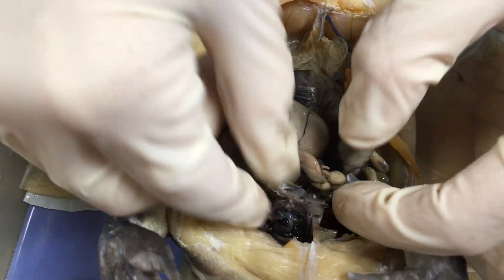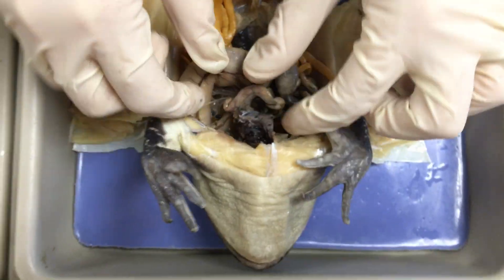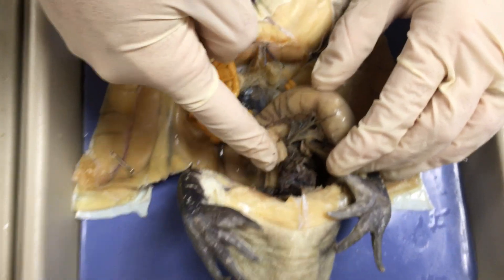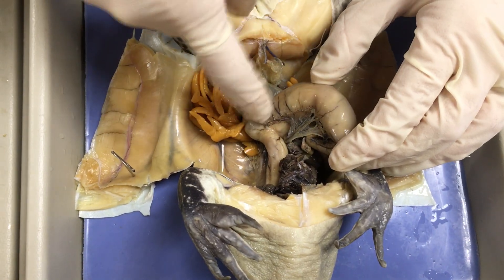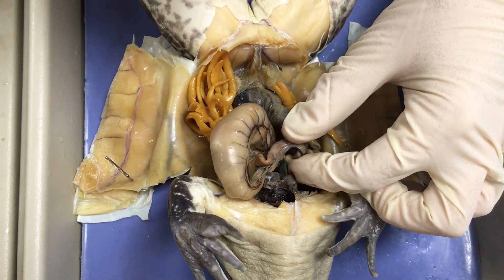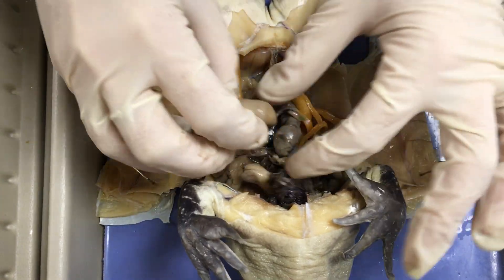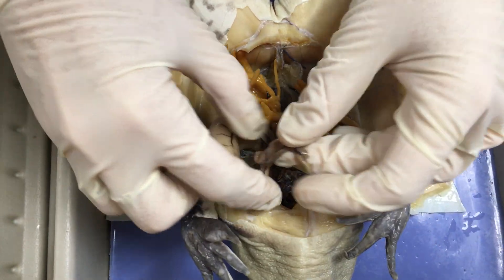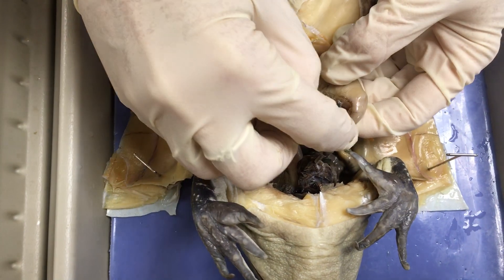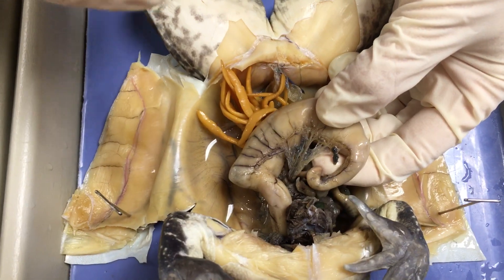Now that we are on digestion, let's continue. When we did the external anatomy, we talked about the mouth of the frog and the esophagus. That connects to all of this — the esophagus connects to the stomach. I sometimes compare this structure to a shrimp tail — this is the big stomach of the frog. At the base of the stomach, where it turns into the small intestine, is what we call the pylorus or the pyloric sphincter.